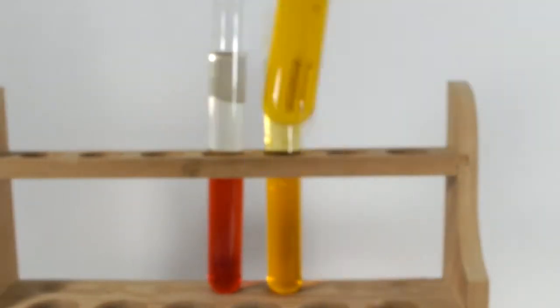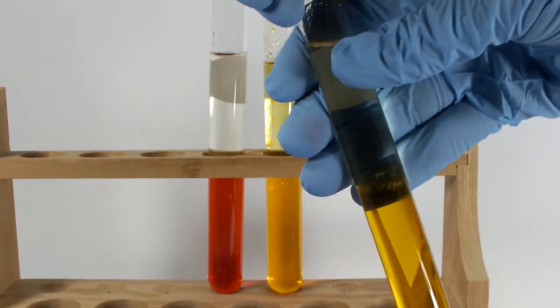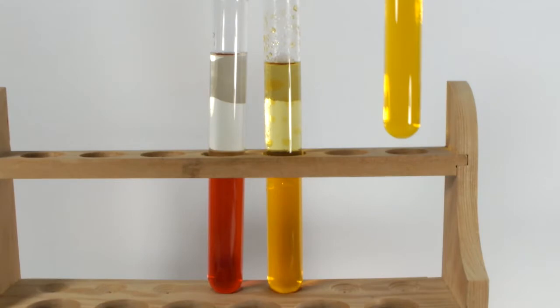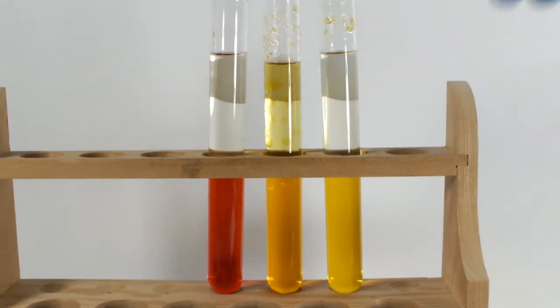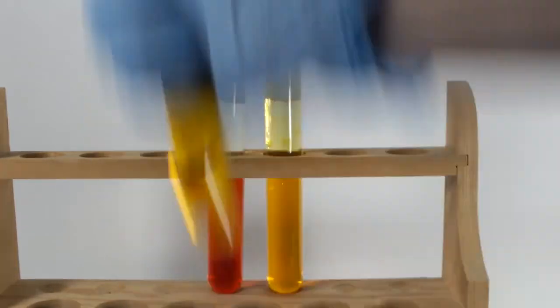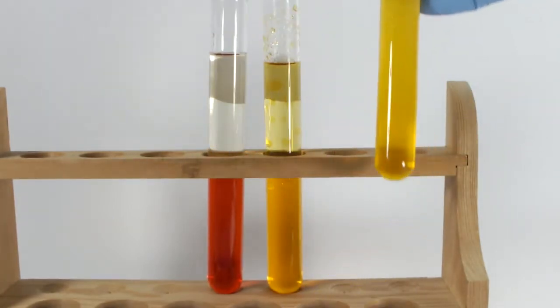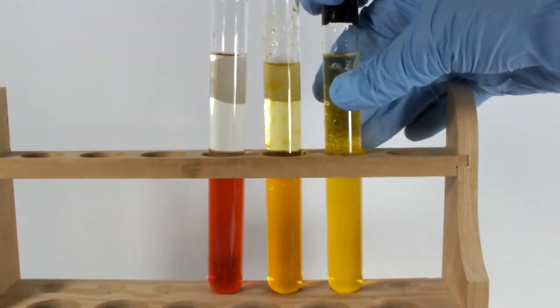Giving the tube with the sodium hydroxide in it a good shake surprised me a little. I'm still careful with that stopper too. There's actually no dye extraction into the organic layer at all. I wasn't expecting that, and so I shook it again, just in case I did something wrong the first time. Though I don't know how you can do that wrong.